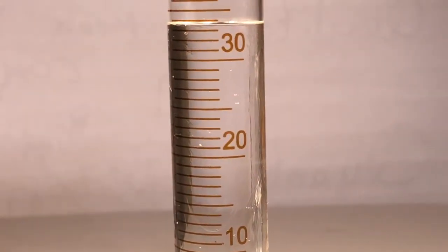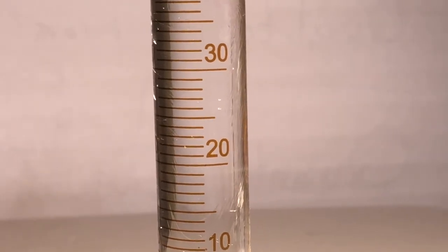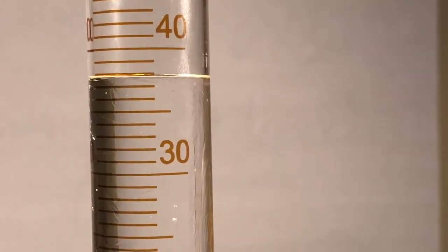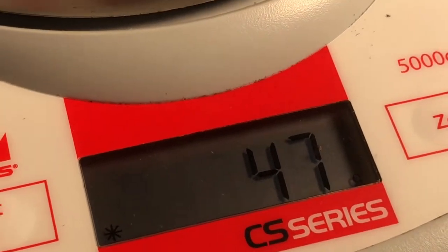Here comes 7. What is that? What are you going to call that? You read it. And I'm going to show you math. We've got one more for liquid 2. There it is.